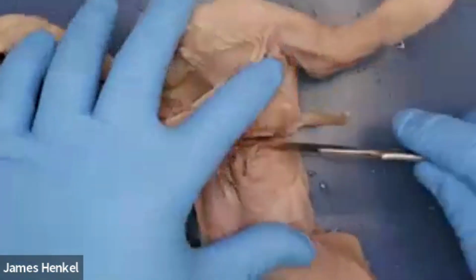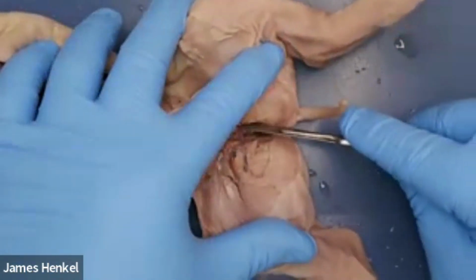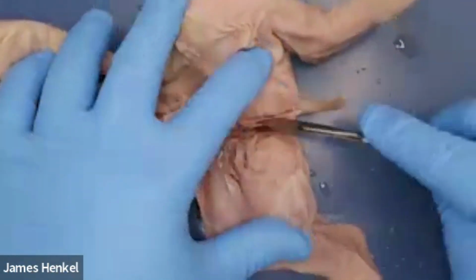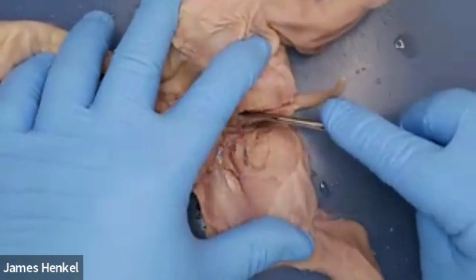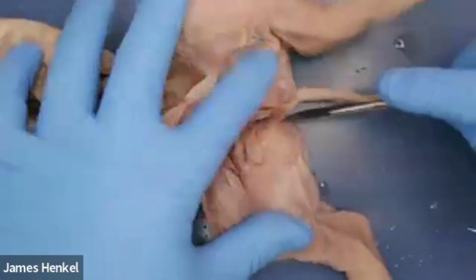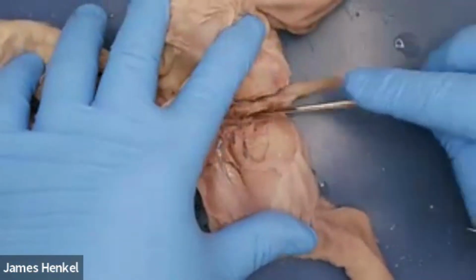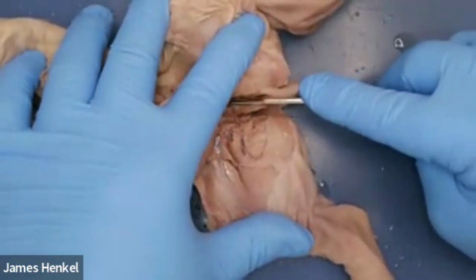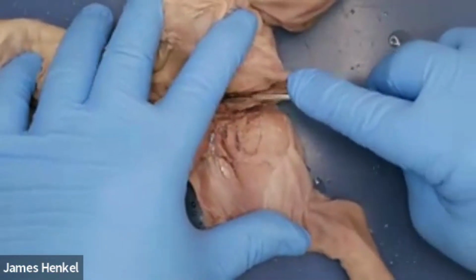And you'll notice that I actually cut on one side of the urogenital papilla. I do not want to cut it because it'll cut part of the reproductive organs. So I'll do a cut on either side. And what I'm doing here is to get a little bit of opening with the muscle. So I can cut in parallel about half a centimeter on the other side.